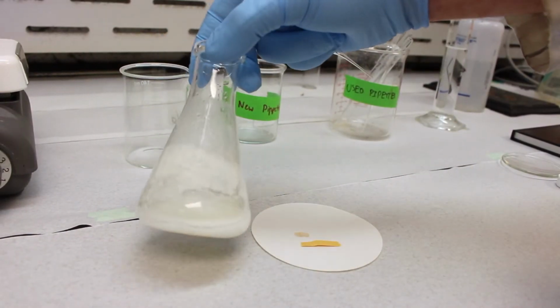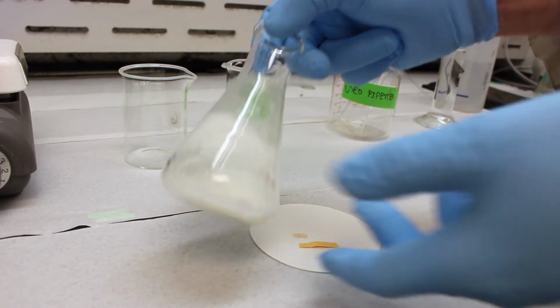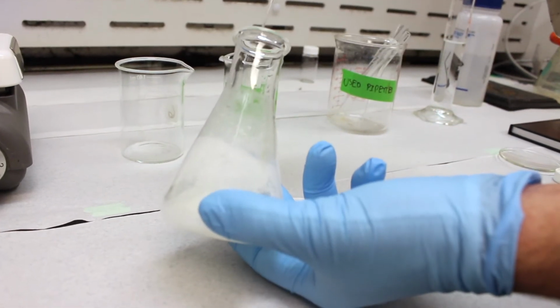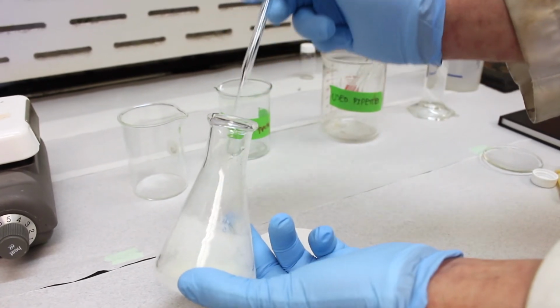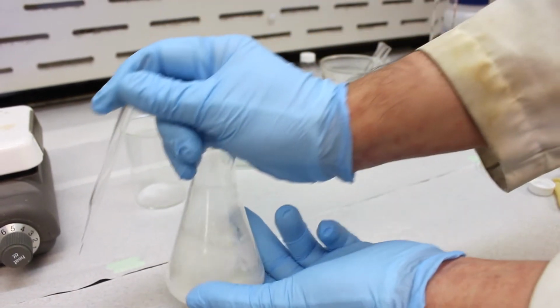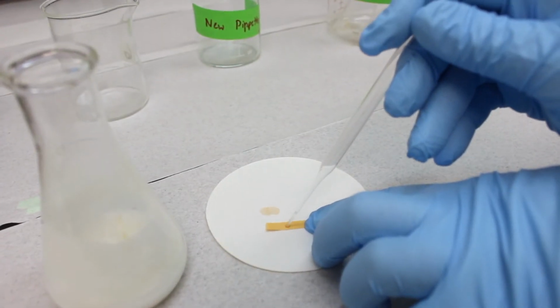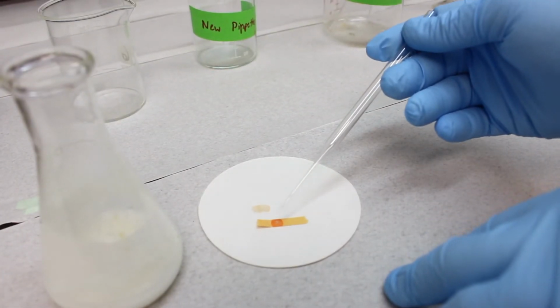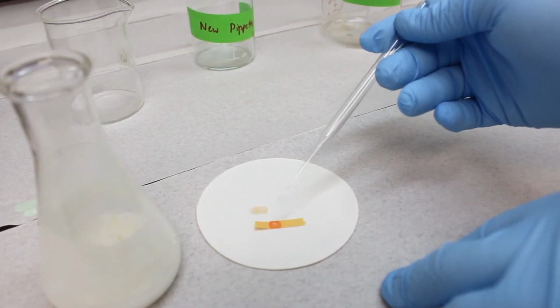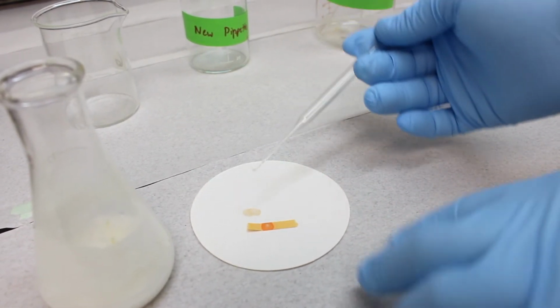So we've got our reaction mixture here, which we've let settle for a few minutes, and for one of the questions on your worksheet, we're going to do a little test here. So I'm going to take this pipette and just get a little bit of the liquid of the reaction mixture. So you can see I've got a little bit of liquid in the pipette, and I'm going to apply some to some pH paper. And if you can see, the pH paper turns red, and the red indicates that the pH is about 2 to 3. So what in the reaction mixture is causing it to be acidic?